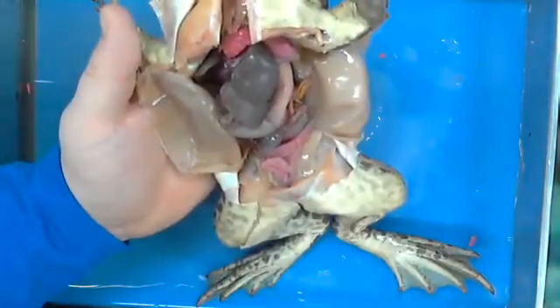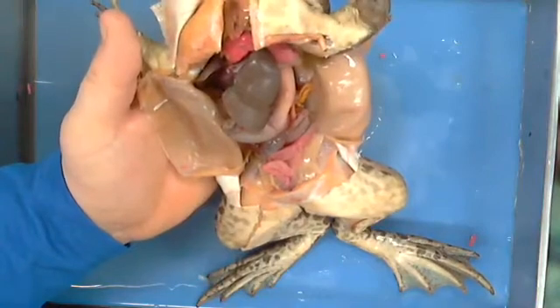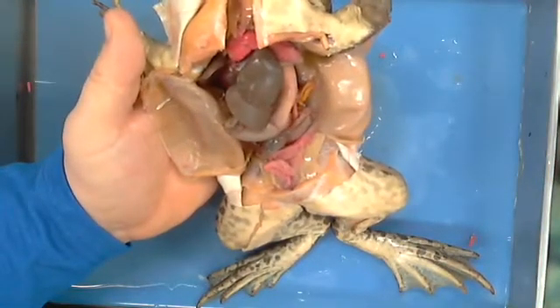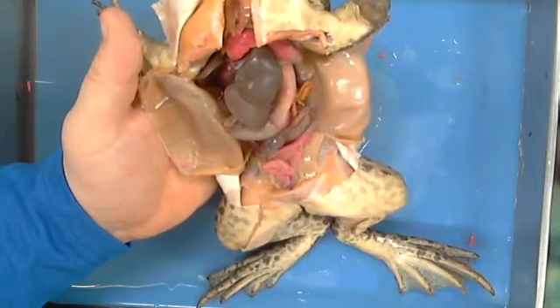So what I'm going to try to do is see if I can hunt one down without having to cut 13 frogs open. And that way, if I can do so, then y'all have the chance to look at what eggs are as well.